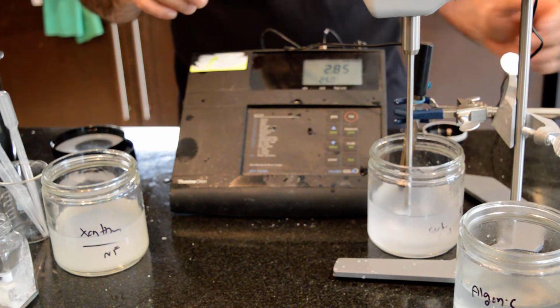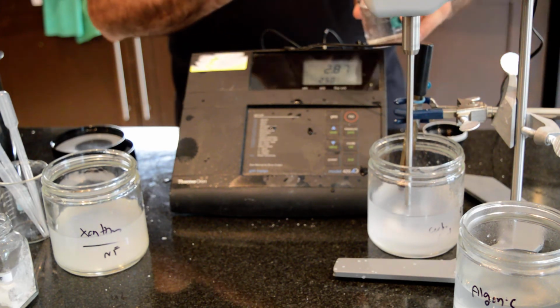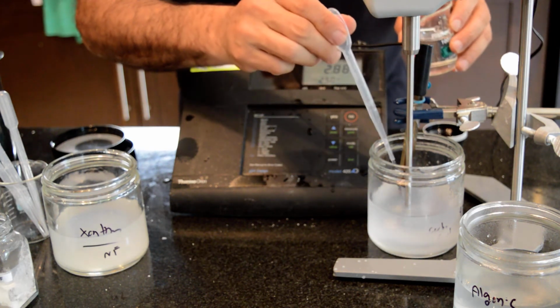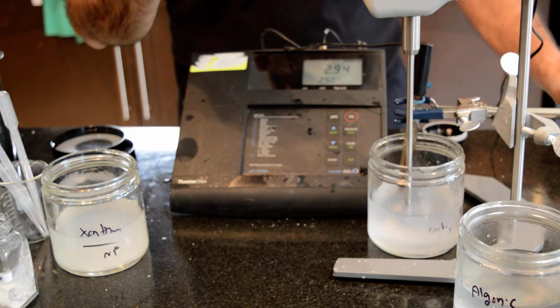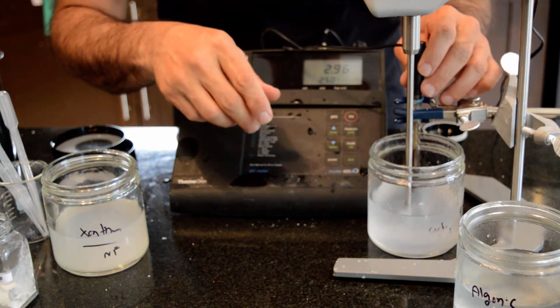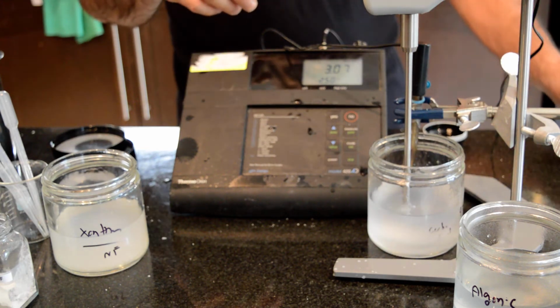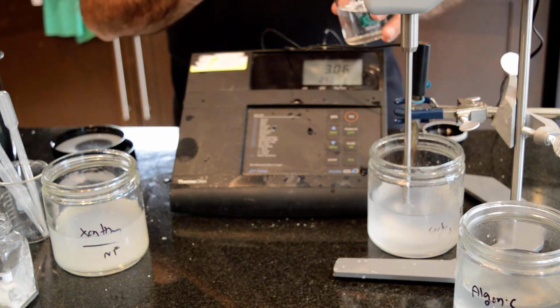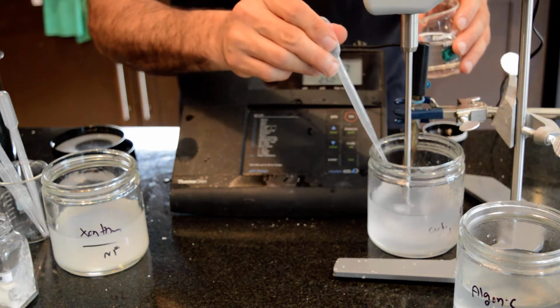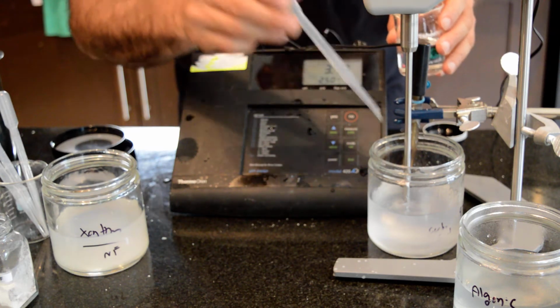So as we can see, my pH is around 2.8, but I'm forming an extremely thick gel in this suspension, extremely thick. So we can tell that if you want to form a very high viscosity gel, like a gel product, probably alginic acid is not the choice, but carbomer is the product that you want.